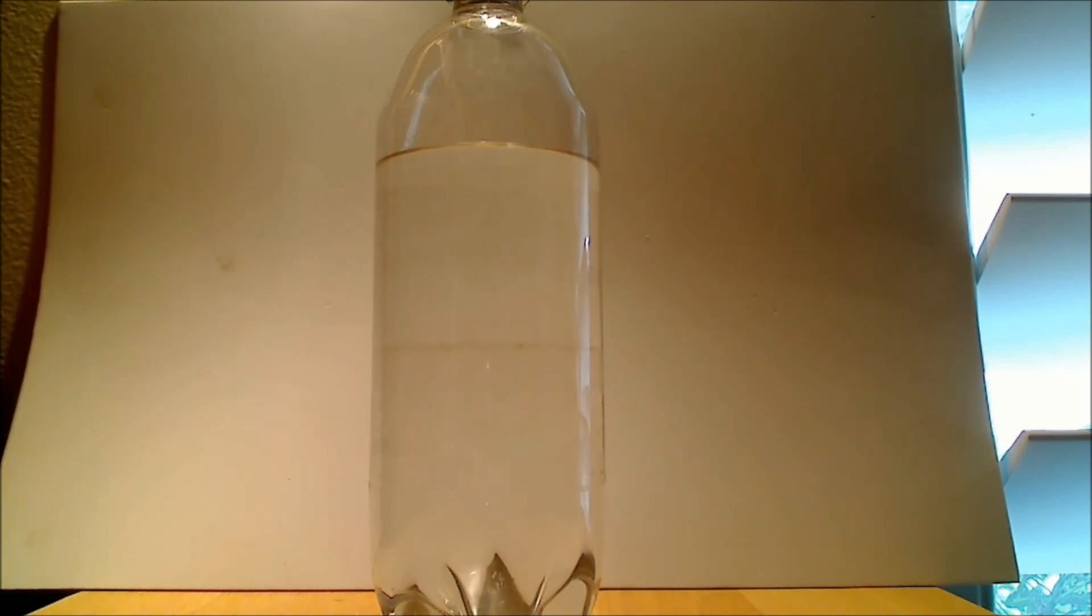So when I shake them up, I form an emulsion. And as they combine or separate, we see a clear boundary.